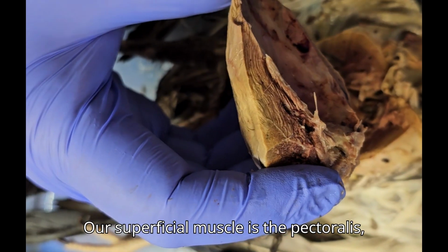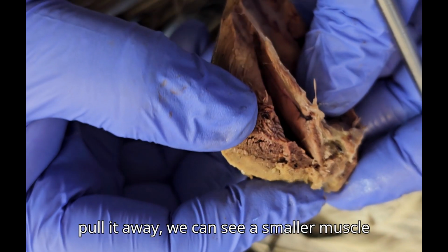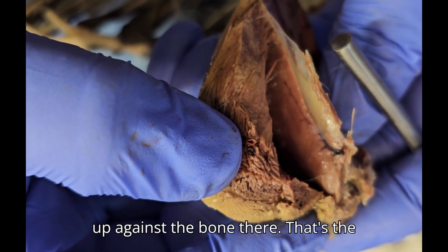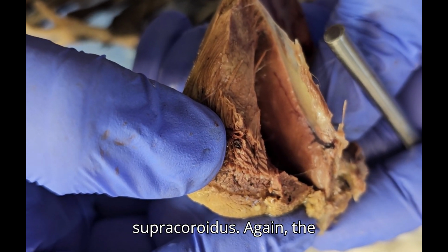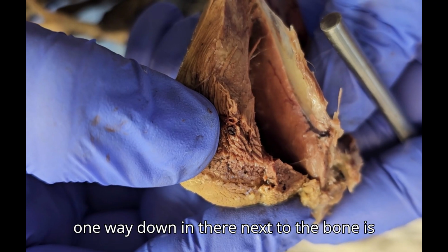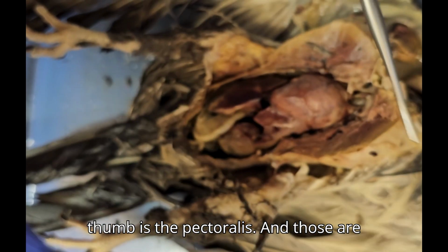Our superficial muscle is the pectoralis, and that's this muscle here. And if I pull it away, we can see a smaller muscle up against the bone there. That's the supracoracoideus. Again, the one way down in there next to the bone is the supracoracoideus, and the one under my thumb is the pectoralis. And those are the two flight muscles.